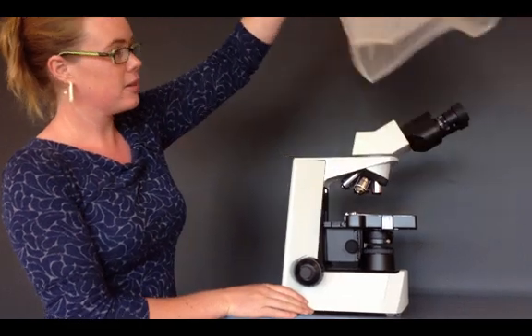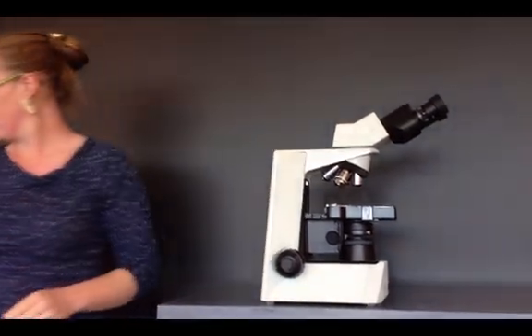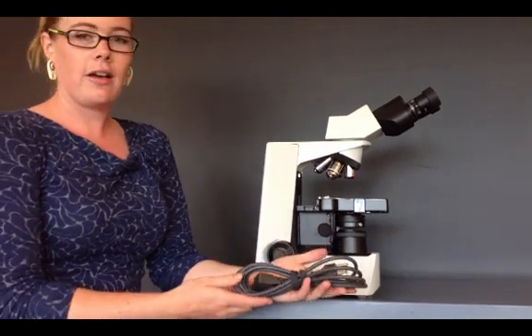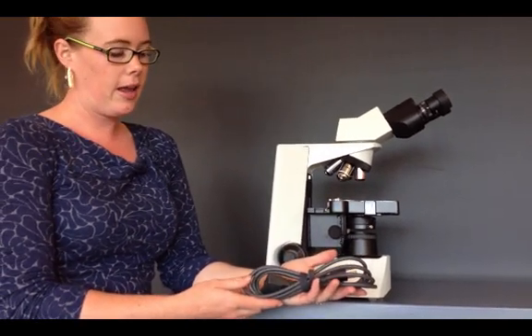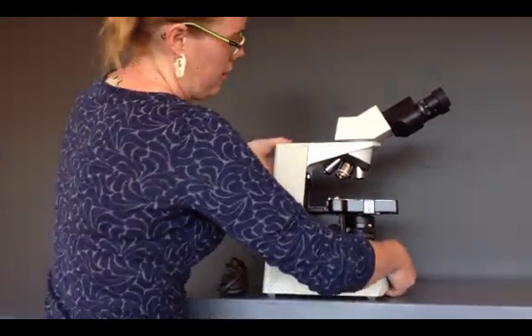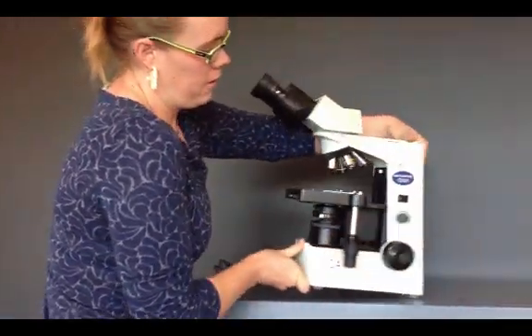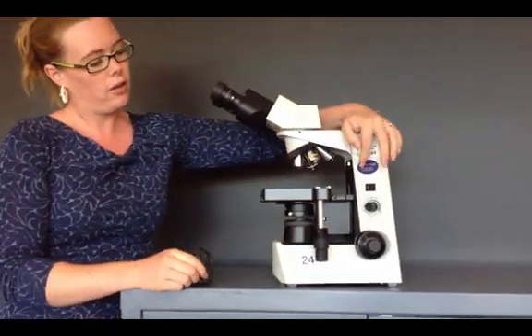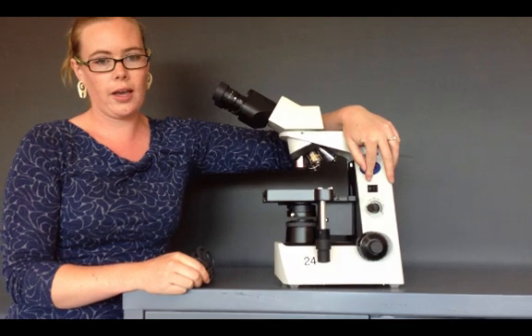Take your dust cover off and then break out your electric cord and plug it in, but do not turn it on. Make sure that the switch is in the off position so the O side is clicked.